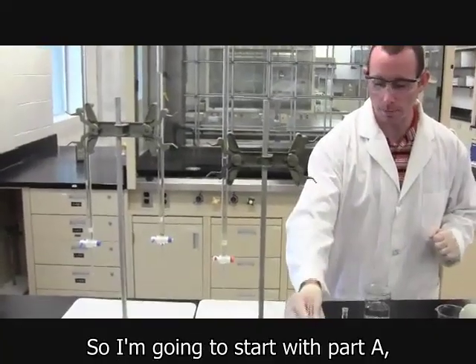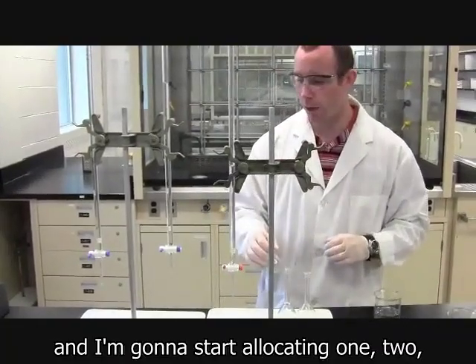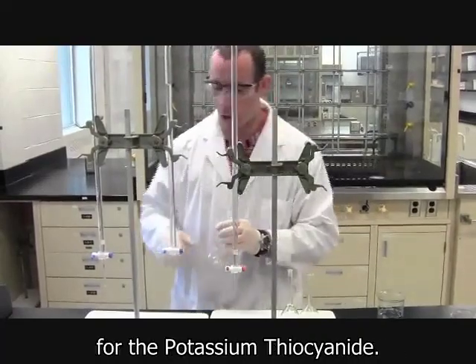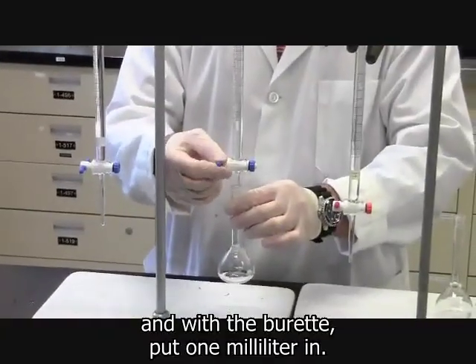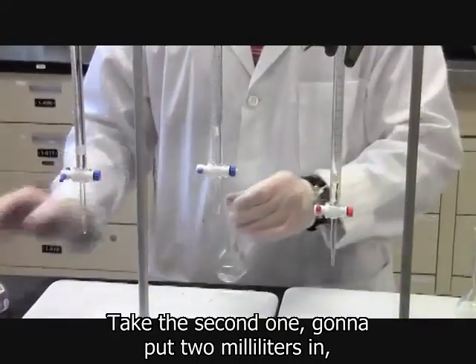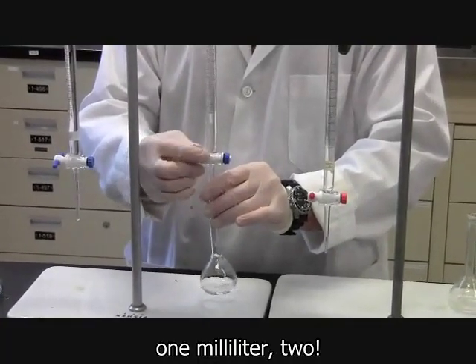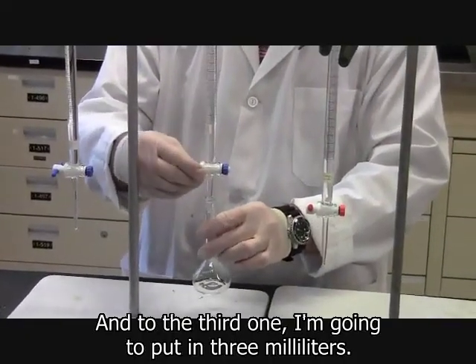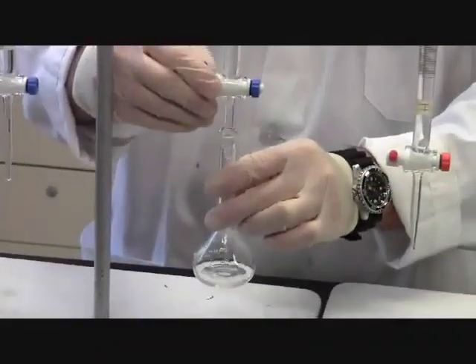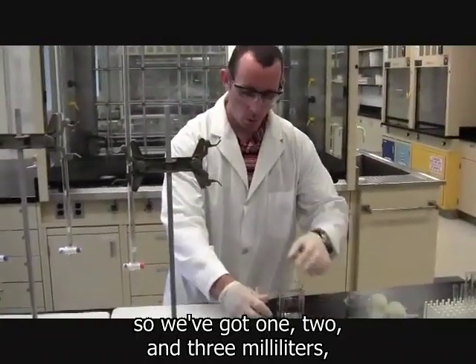So I'm going to start with part A. What I have is 3 volumetric flasks. And I'm going to start allocating 1, 2, and 3 mils to each one of them for the potassium thiocyanate. So I'm going to take a measurement, and with the burette, put 1 milliliter in. Take the second one, I'm going to put 2 milliliters in. And to the third one, I'm going to put in 3 milliliters. So I've got 1, 2, and 3 milliliters.